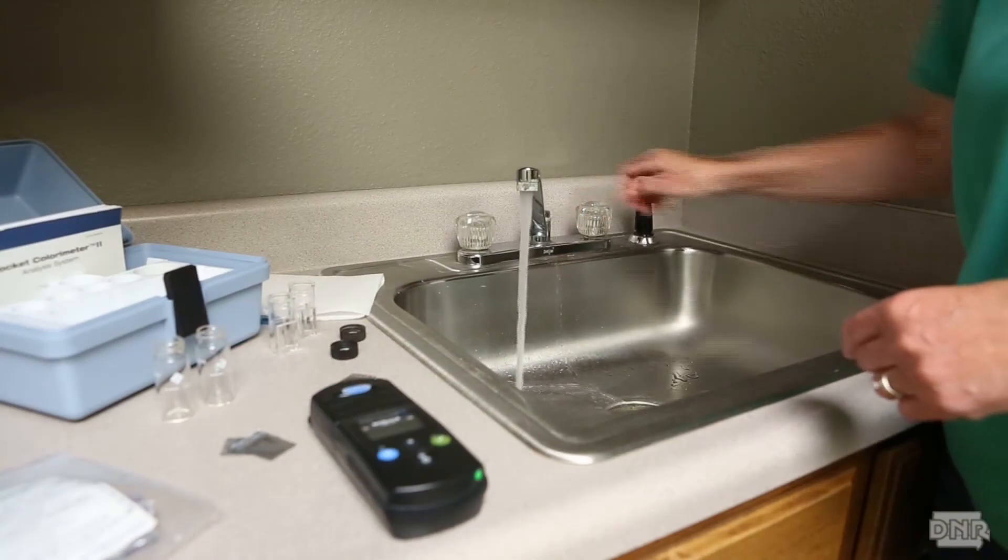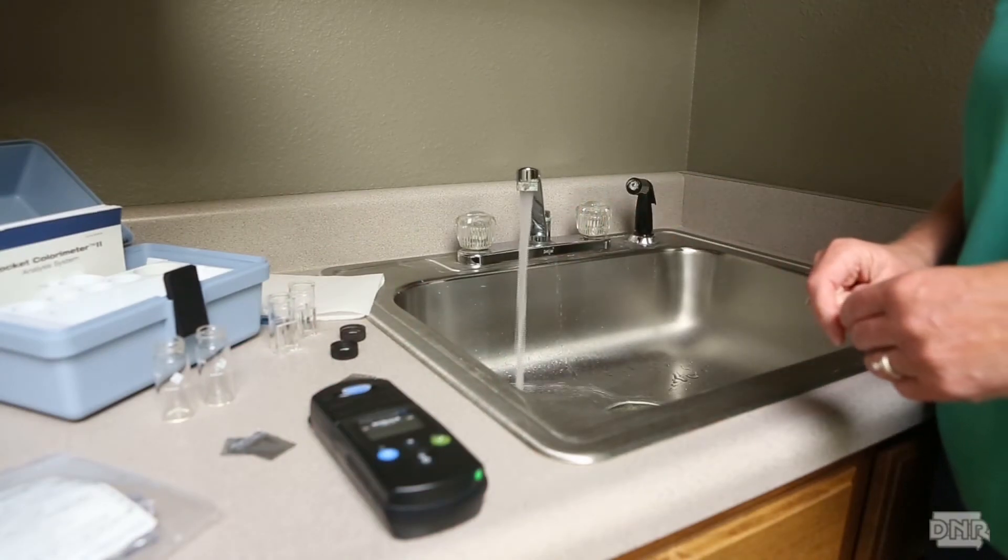In the distribution system, this means that you must let the water run to clear the internal plumbing and service line. Typically, the water temperature can be used as an indicator because the temperature will stabilize when the water is from the main. The sample site should not be softened or have any other in-house or point of use treatment, such as a filter, RO unit, or other device. Many of these treatment devices will remove chlorine. It is extremely important that you follow the appropriate sample collection procedure to ensure your results are accurate and reflect the actual conditions of your water.